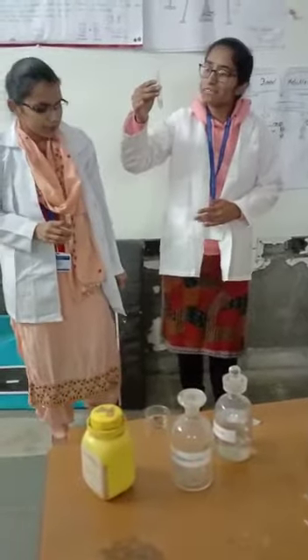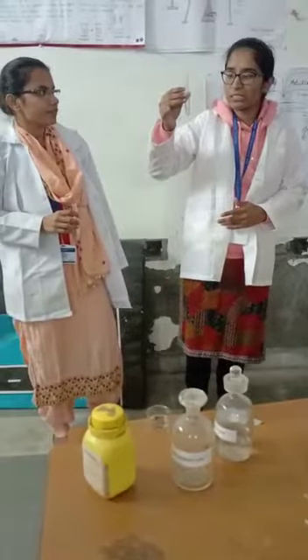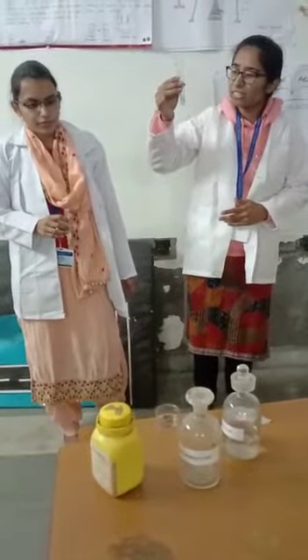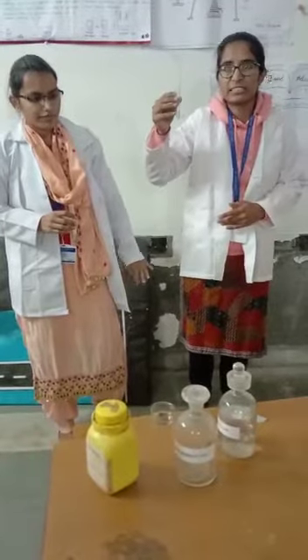Now we take a pinch of CaSO4 in some amount of concentrated H2SO4. By adding this, we get that CaSO4 is insoluble in concentrated H2SO4.